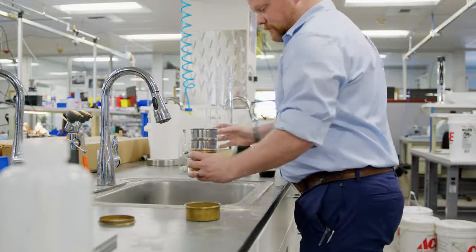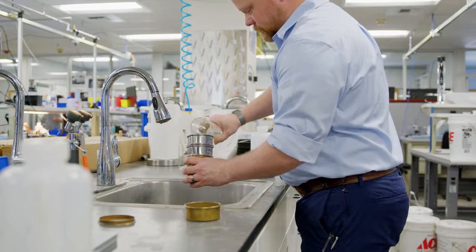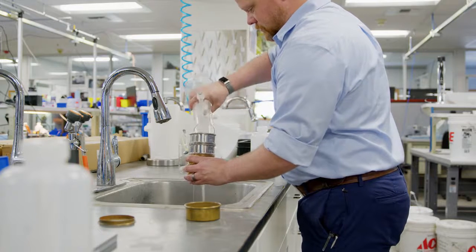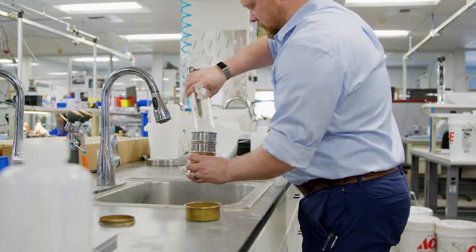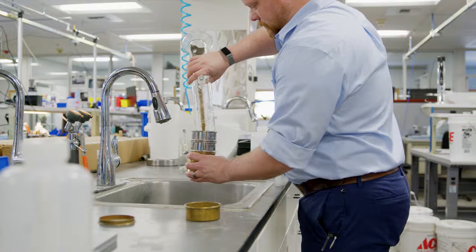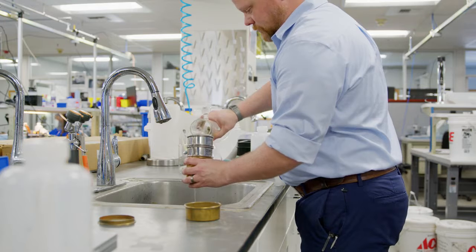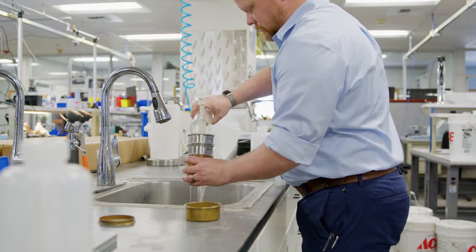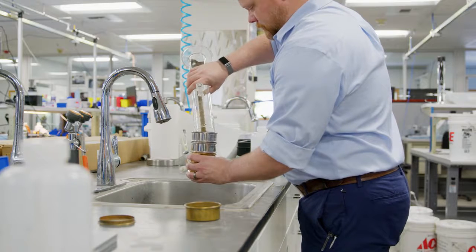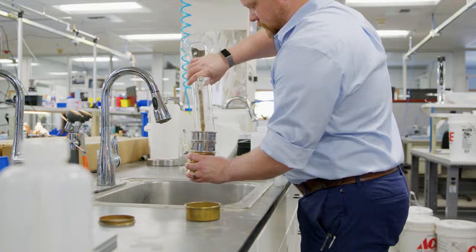Once the PARIO measurement is complete, the measurement sample needs to go through wet sieving, one final post-processing step to determine the sand content. We recommend doing the wet sieving right after the PARIO measurement using the same sample to ensure the results are consistent with the PARIO results. We also recommend doing the sieve analysis with a three-dimensional working screening machine combining throw pulse and angular momentum. This guarantees an optimal movement of the screenings.